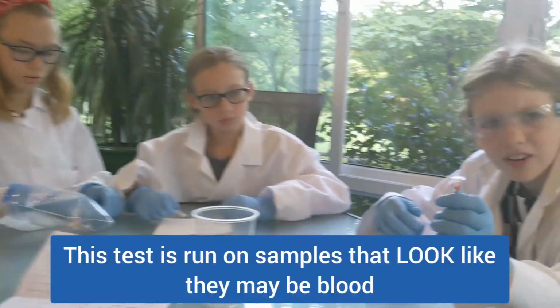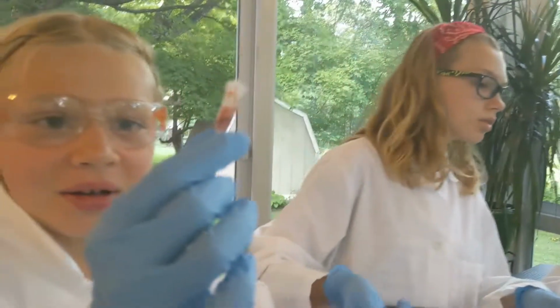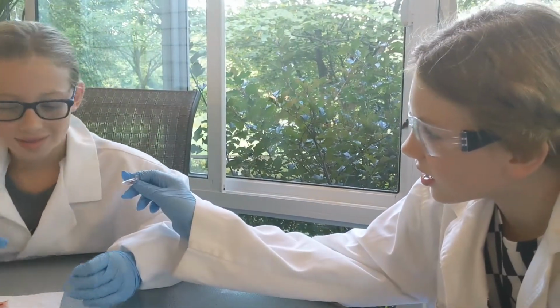Why is it dried, stringy? Well, it came from a scene of a crime. Oh my goodness. And we have to find out. Oh, maybe there's hair in there as well. Was the person who died okay?